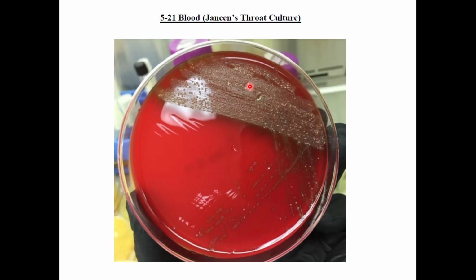Okay, so from this picture, unfortunately, it's very hard to tell which pattern we would see, but very likely overall we would see a pattern of alpha hemolysis, because most of us, of course, all have staph and strep species in our throat. They are part of our normal microbiota. Okay, but most of them would only do alpha hemolysis, so we would expect a greenish color. Very rarely are you going to find just gamma. Okay, so this is what we would probably get for most of you.